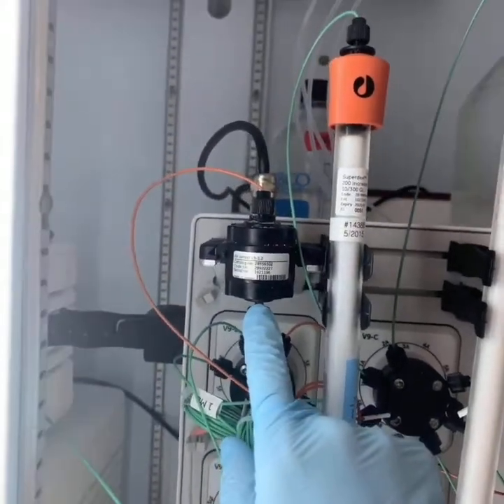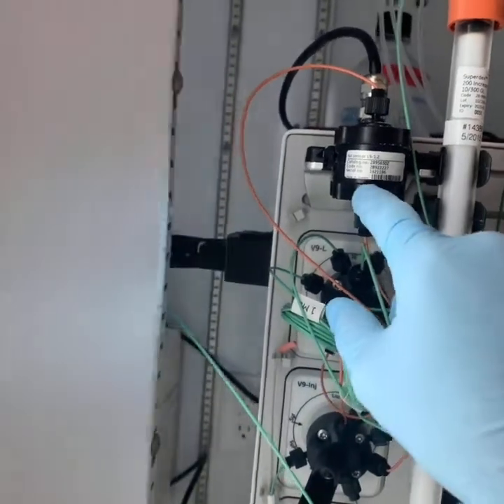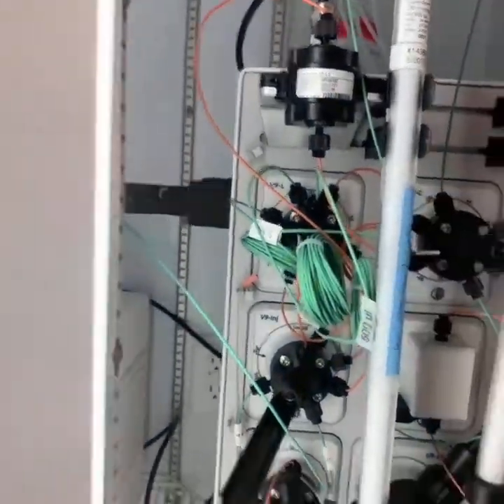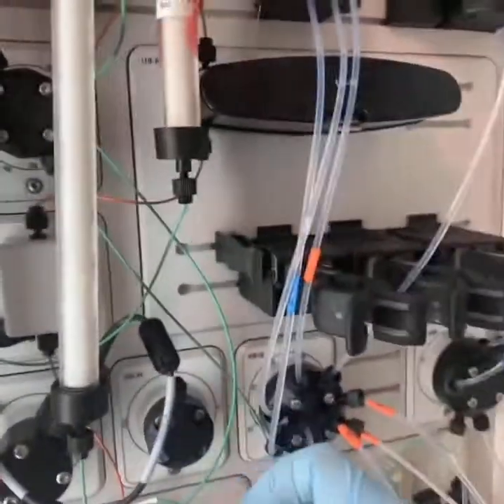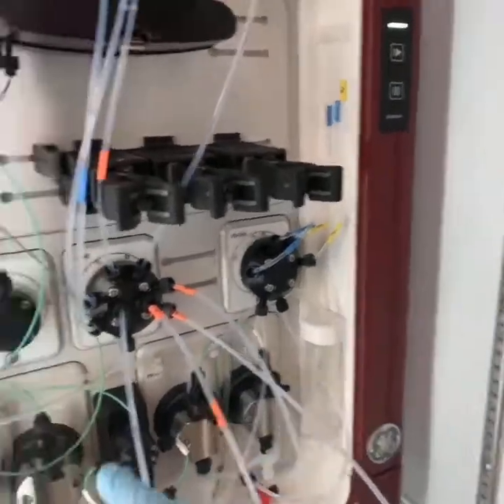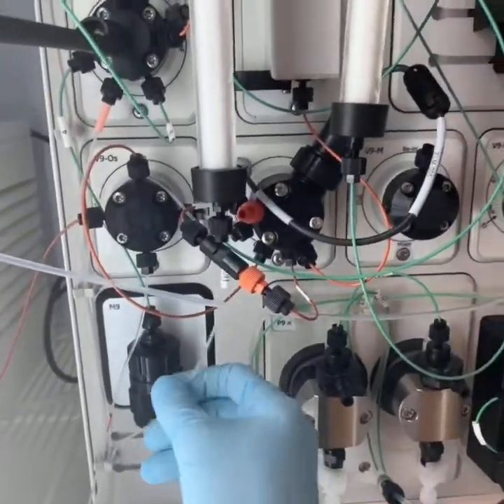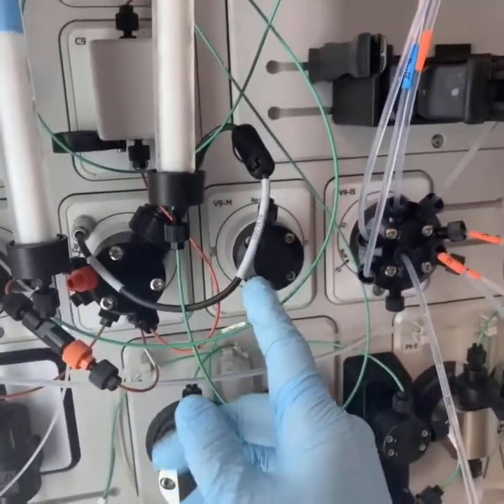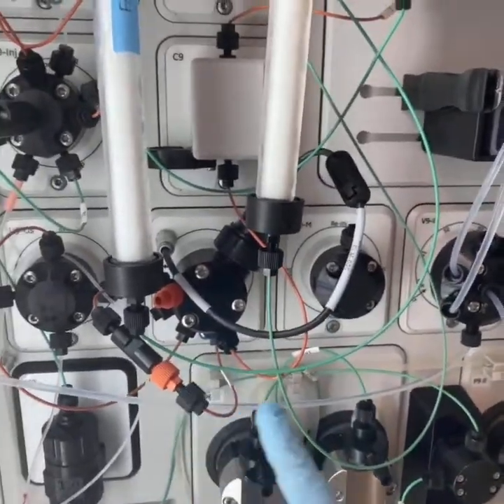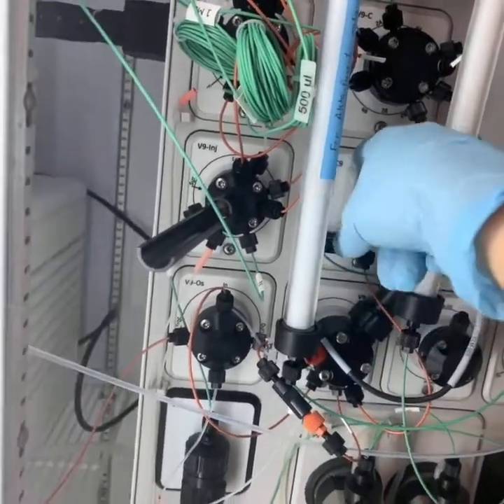This is an air sensor because you don't want air to get into your column. That's really bad for the column. So it has an air sensor to prevent that. Some other things it has. So this is the UV monitor. These are just holders, clamps for holding things. Some more mixers. That's most of this stuff. So here's the conductivity meter.